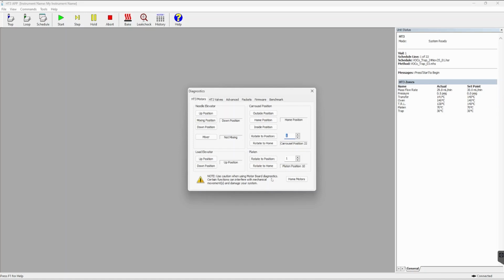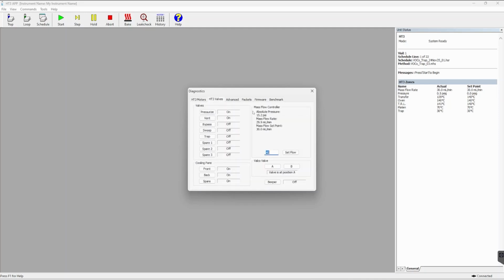These features are useful, for example, when you have a vial in a certain position in the carousel and it's not come back up, so you want to unload it manually rather than doing an automatic unload of the entire carousel. Next tab is HT3 valves. Again, it will let you know the status of all your valves in your instrument. It also gives you this option to set flow.